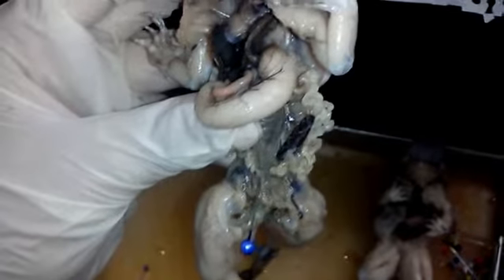The next digestive part is the cloaca, a common chamber into which the intestinal and the urogenital tract discharge.